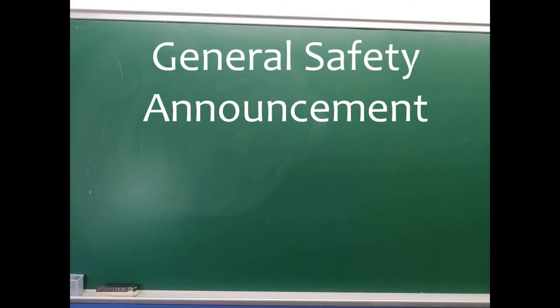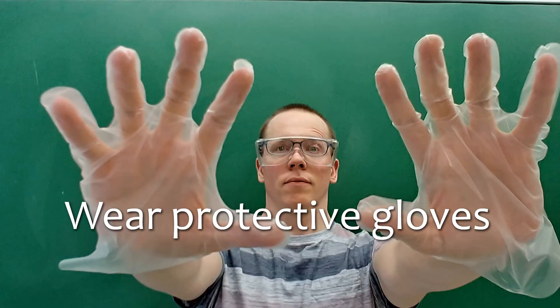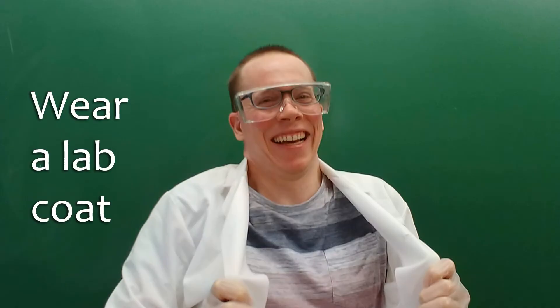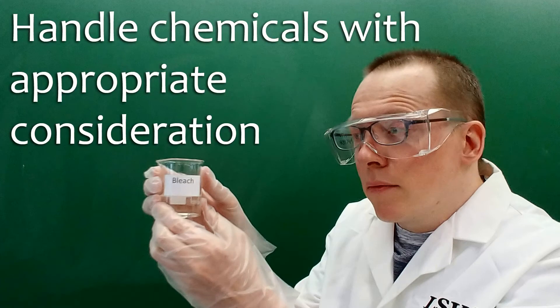And now for an important safety announcement. You may need to consider wearing lab glasses. You should wear gloves. And how about a lab coat? When handling certain substances, take care!